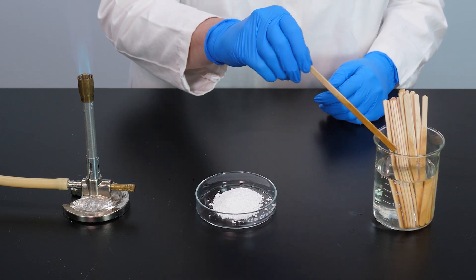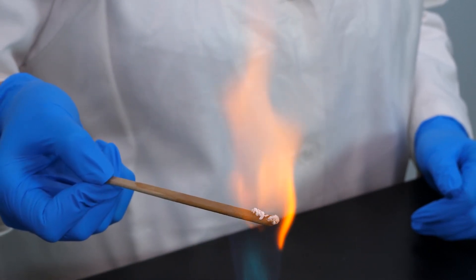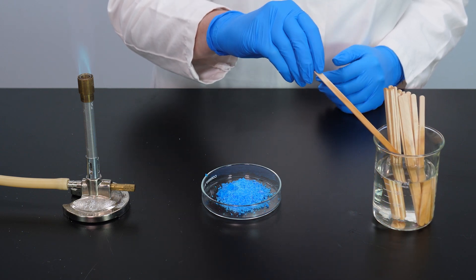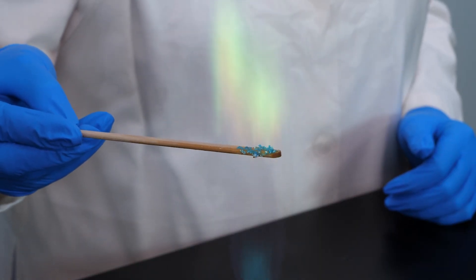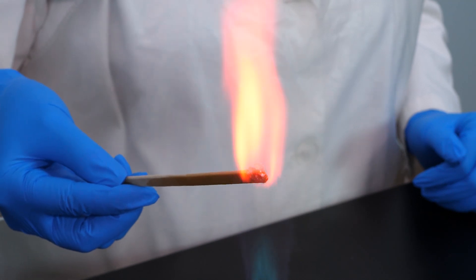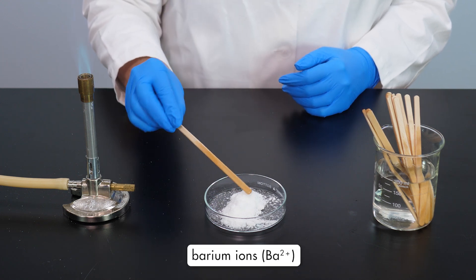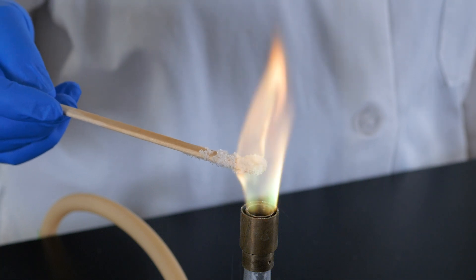Let's continue by testing a compound containing calcium ions. How would you describe the color of the flame emitted by the calcium ions? Record the results on your table. Next, let's test a compound containing copper ions. How would you describe the color of the flame emitted by the copper ions? Record the results. Now we will test a compound containing strontium ions. How would you describe the color of the flame? Record the results. Next, we test a compound containing barium ions. How would you describe the color of the flame emitted by the barium ions? Record the results on your table.